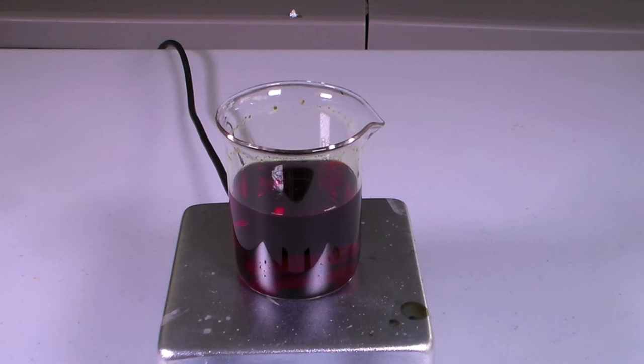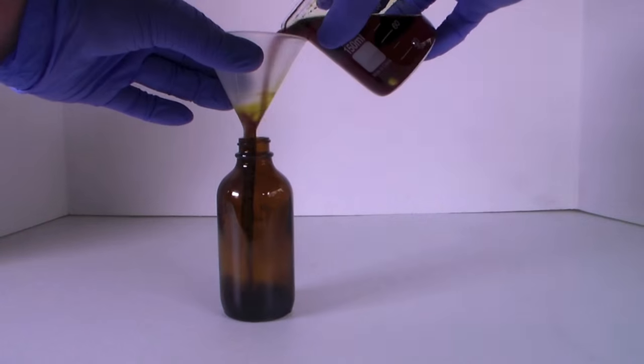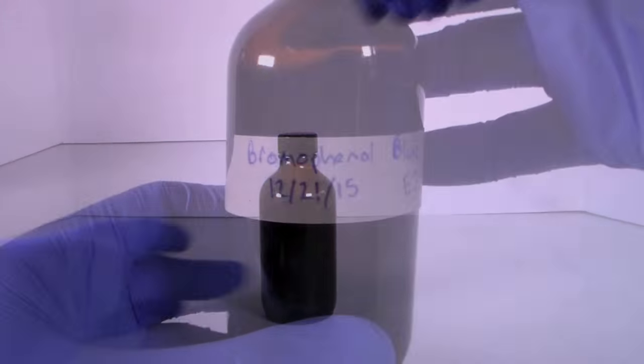This solution should last a very long time since you only need a few drops to measure the pH of a solution. Make sure to store this solution in an appropriately labeled container.